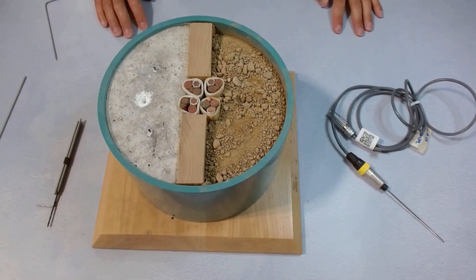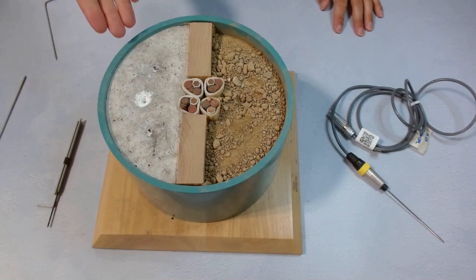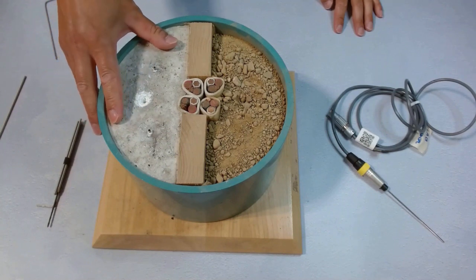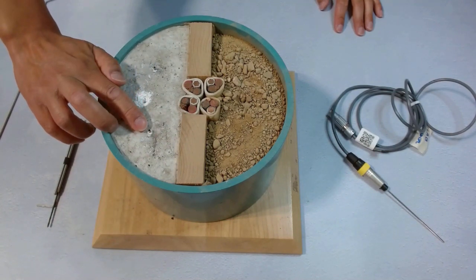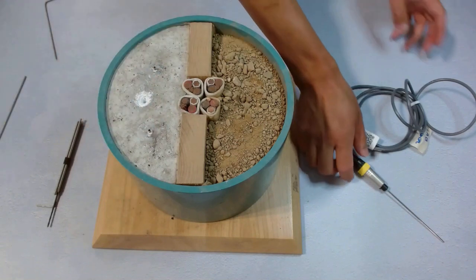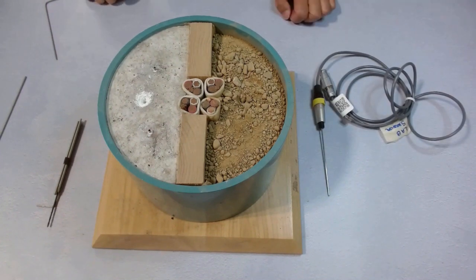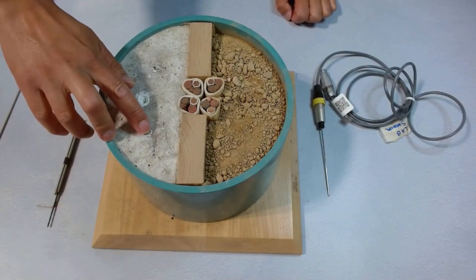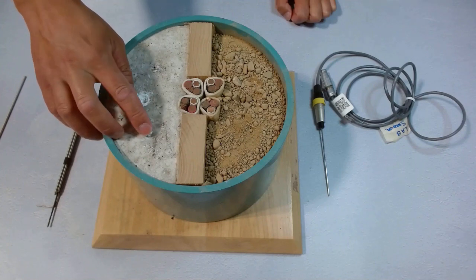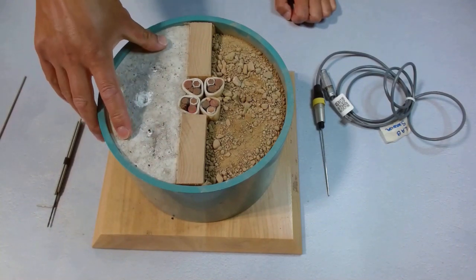There are some other cases we need to use needle sleeves, like condensable samples such as concrete, cement and some resin samples. We can insert the needle sleeve before it is condensed. After it is condensed, the sleeve will stay solid in there and make pretty good contact with the sample, and we can stick the needle in and make measurements. We need to bury the needle sleeve as much as we can but leave just a little bit in case something else goes in there to stop the needle. We need to make sure it's not too much above the sample so we're not measuring too much air.